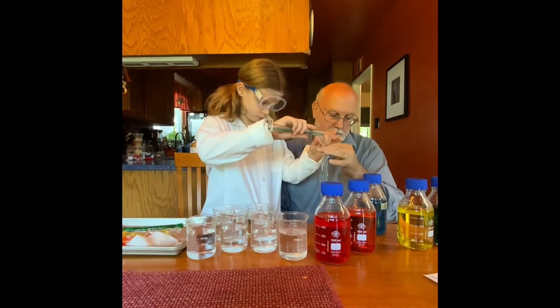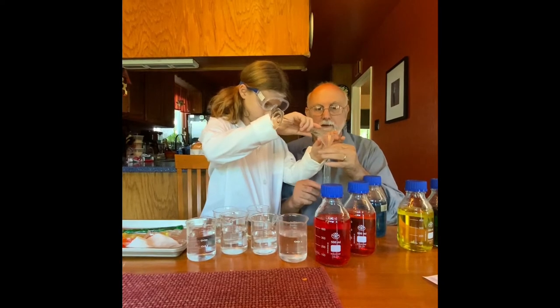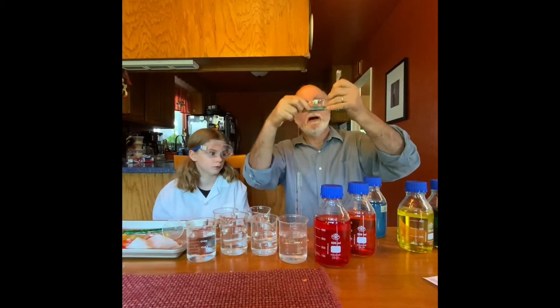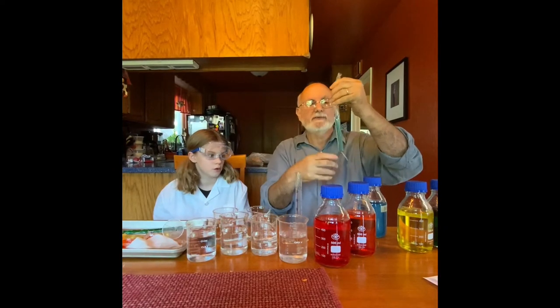Okay, there we go, perfect. Set it down and I'm going to tie off this end. When I tie it off, water will potentially be going into or out of the bag depending on what the solution is inside the dialysis tubing compared to what's outside. Because water is often entering, you want to have a lot of slack — if it's too tight like a sausage, there's too much pressure inside and water won't be allowed to come in.